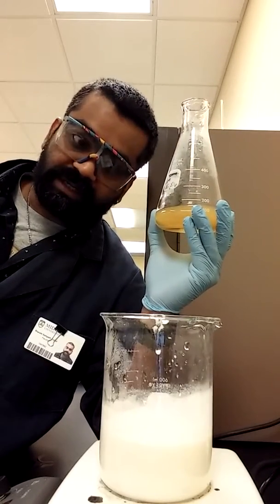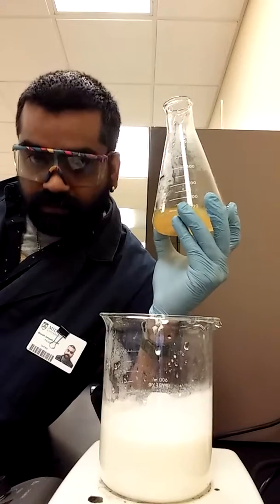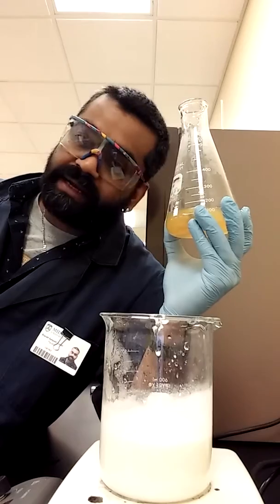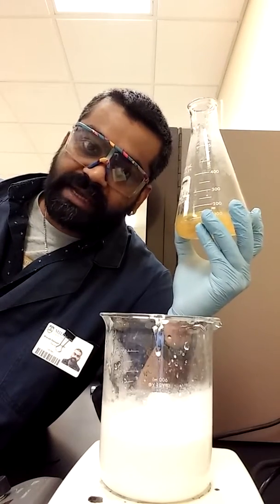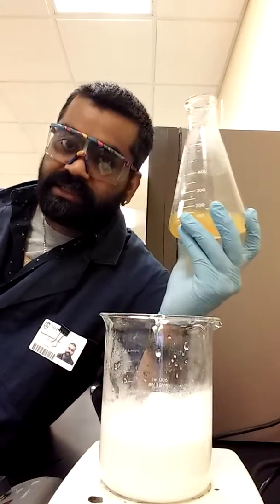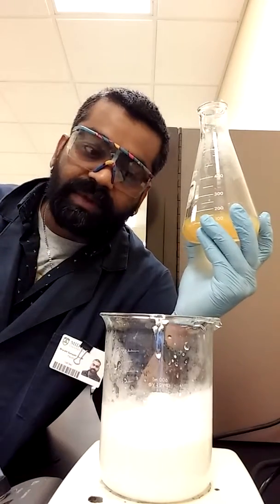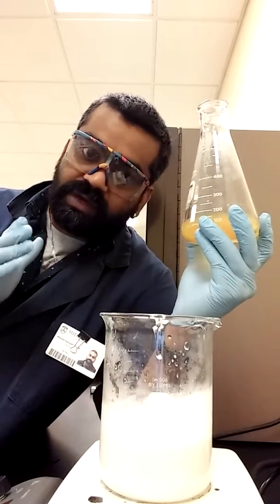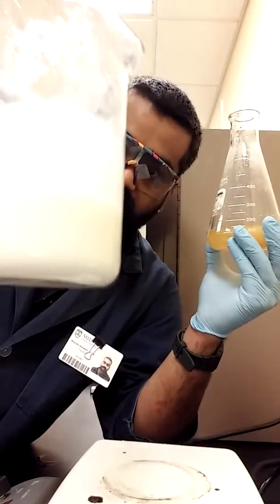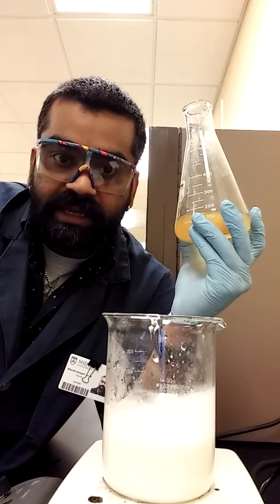So we have an aqueous waste that we've kept in our general chemistry laboratory. That's only meant for aqueous waste. And then we also maintain separate waste for various type of reactions we do here. So this is going to go in aqueous waste, which I'm going to get rid of it. And then you can see that we're on step four. We added a diluted concentrated sulfuric acid to our yellow precipitate that was on the bottom. The moment I added it, it turned white. Now, if any of you have actually seen citric acid in a pharmacy or grocery store, you can find them anywhere. Just solid citric acid, they're cheap. We're doing this to understand the chemistry behind it, but we're not going to get it perfectly pure. But citric acid is white in color. So to have a yellow citric acid means that's not acceptable. But to me, it looks like you can't get any whiter than that.